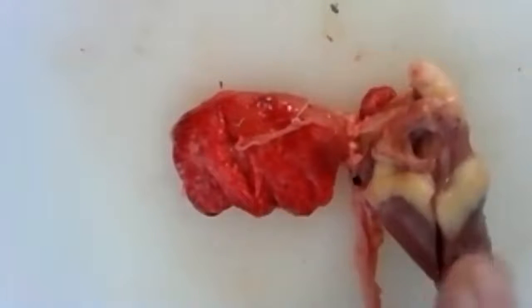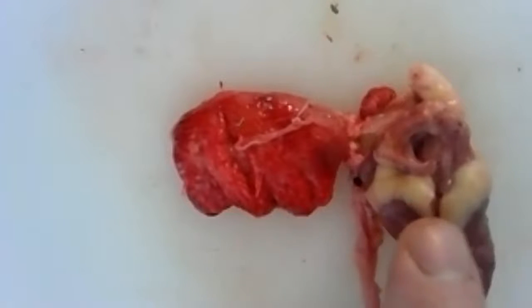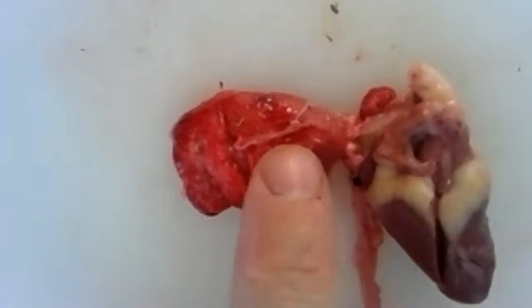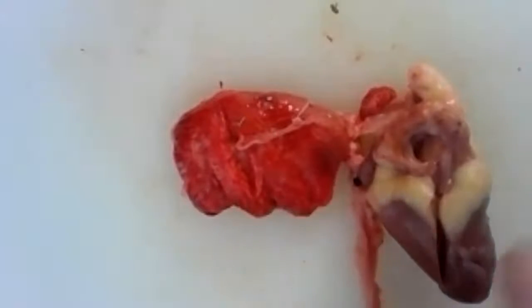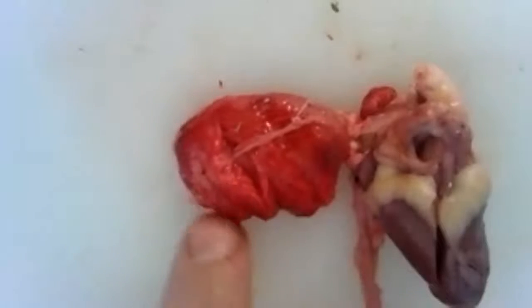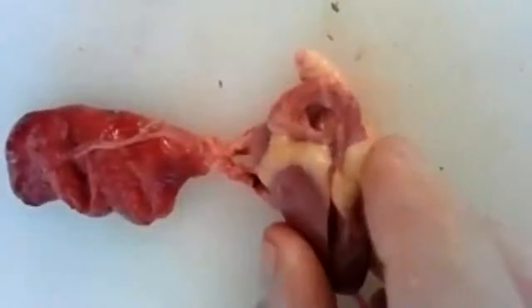Now, if you think about that, take a look at this heart. If I touch that thing, it hardly moves at all. That is a tough little nugget right there. But this is a delicate little lung that we need to be careful with, right? Protect it from coronavirus and from smoking and other problems that can happen to the lungs.